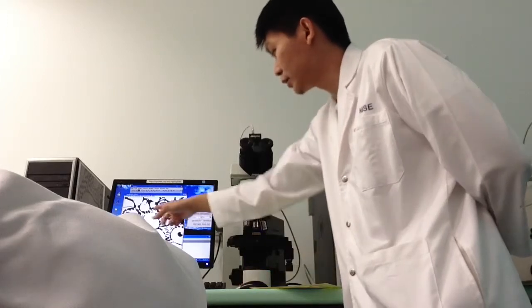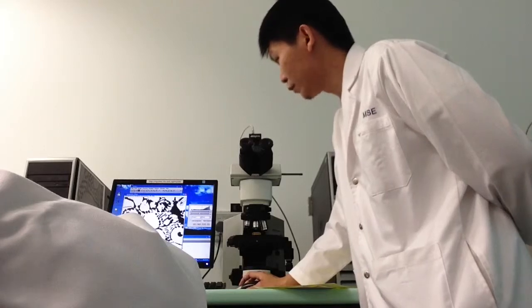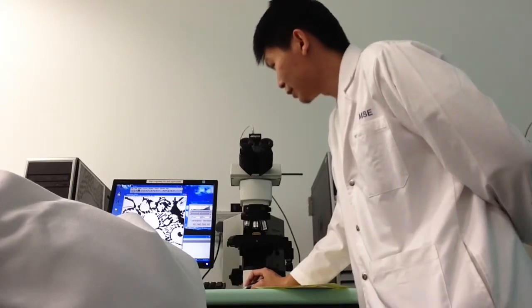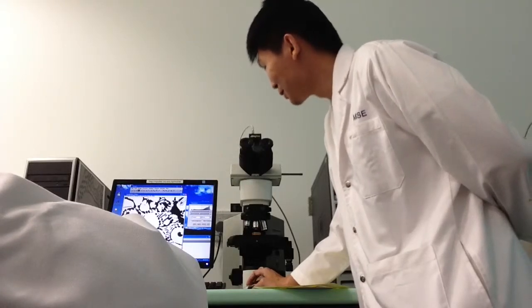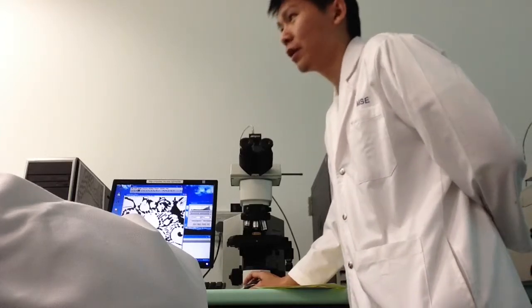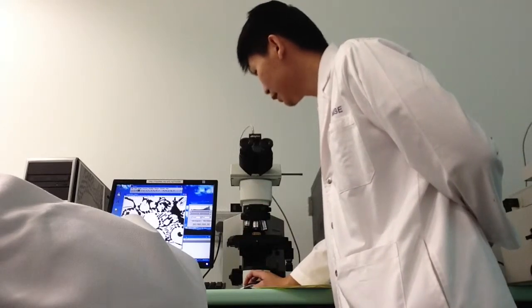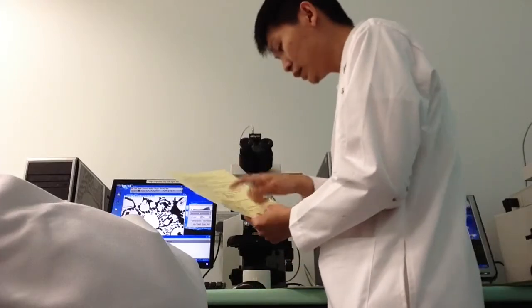This will actually remove the yellow box. Then you use your freehand. Freehand, yes, correct. Maybe you want to try not to cut too much into your black region. Then after you have drawn out your freehand, same thing again.